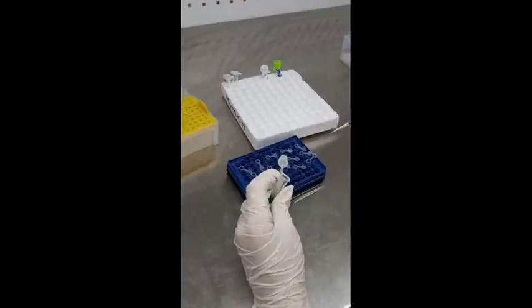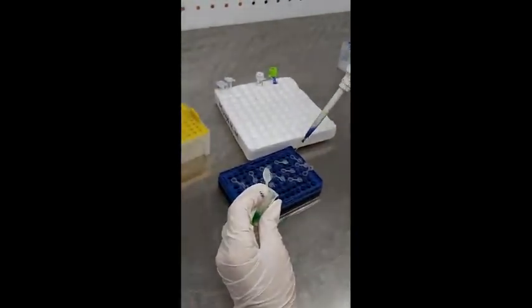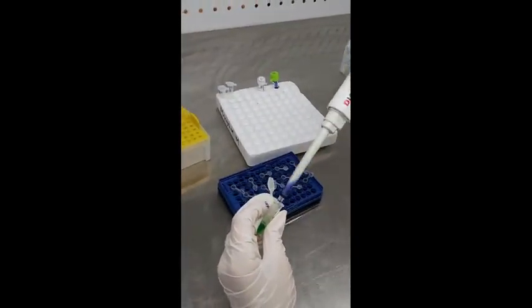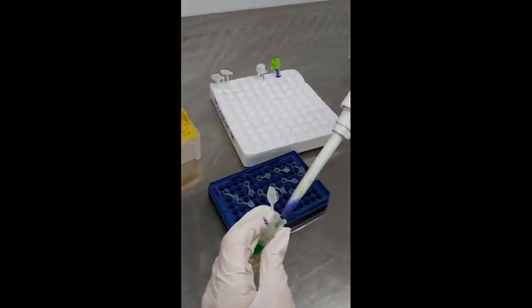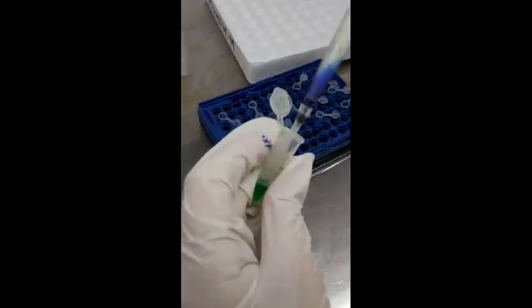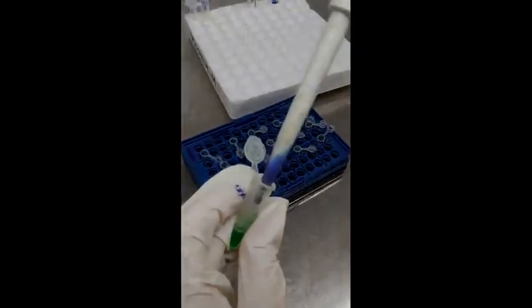Now you have to vortex this whole solution so that you get a uniform mixture and all components are well mixed. Then add 24 microliters from this solution into each of the PCR tubes — 24 microliters per PCR tube. We prepared this for 11 reactions, so we are now adding 24 microliters to each PCR tube.